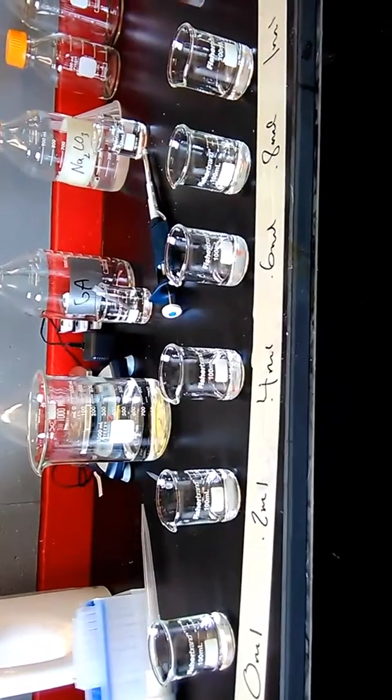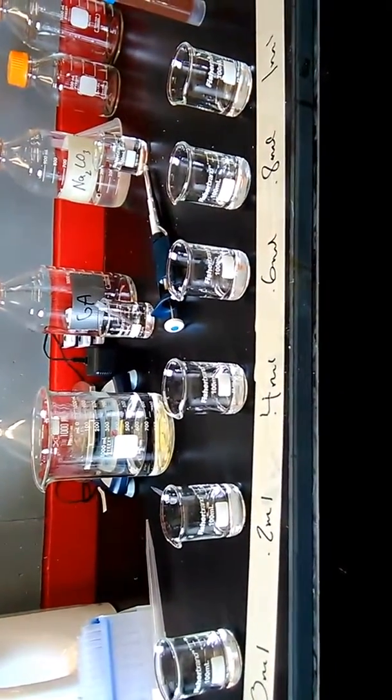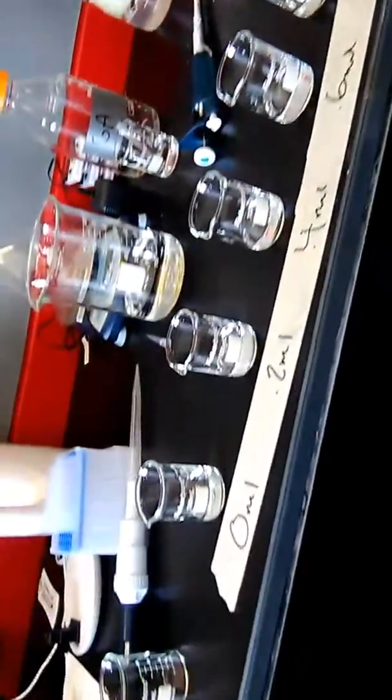So I am going to go ahead and do that. And then we're going to set a timer for eight minutes. So I'm going to add a little bit.